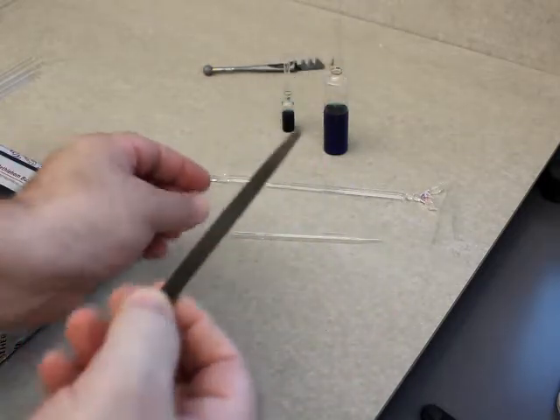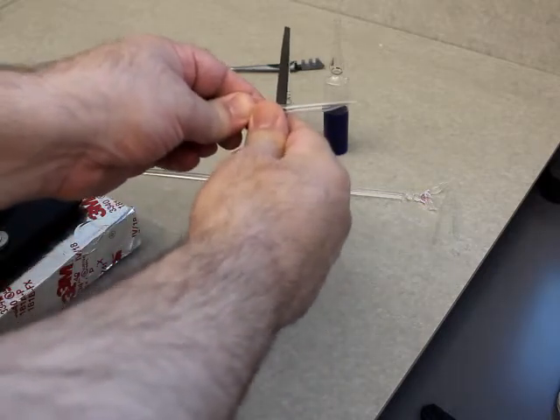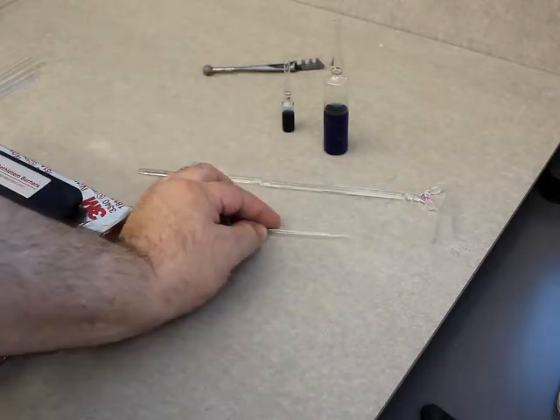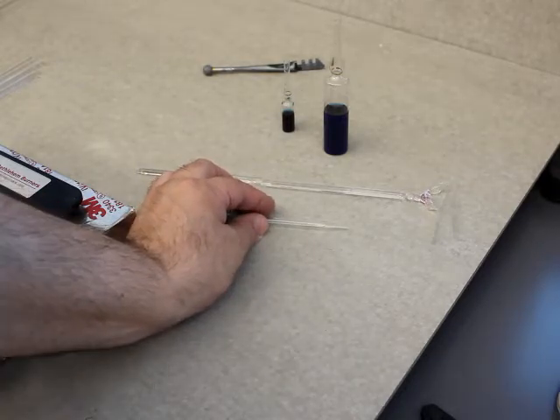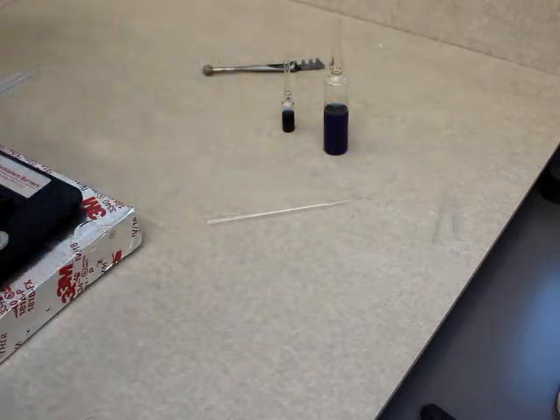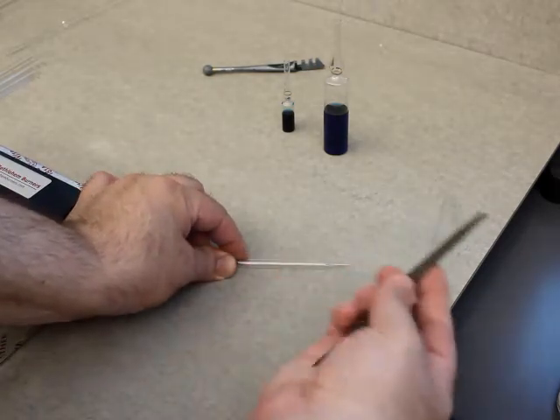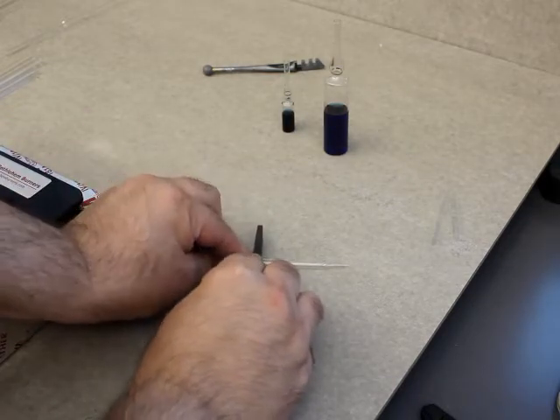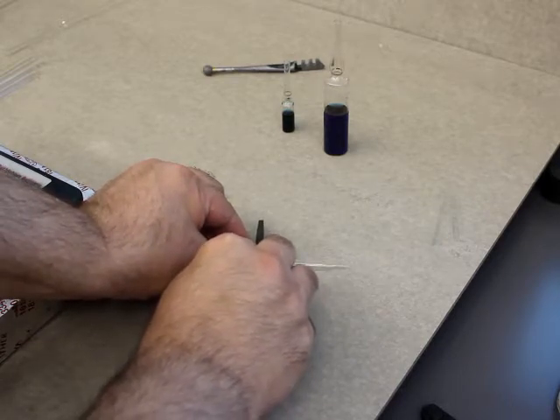Now I'll do this again. I'm going to take my glass triangle file. One of the things is you will see people score it like this, holding it in their hands. If you read through any textbook, they tell you to place the object on a nice flat, clean countertop and remove any clutter. With the edge of the triangle file, I'm taking this, pushing down — but not with a tremendous amount of force, just enough that I've got some pressure. And there it goes.